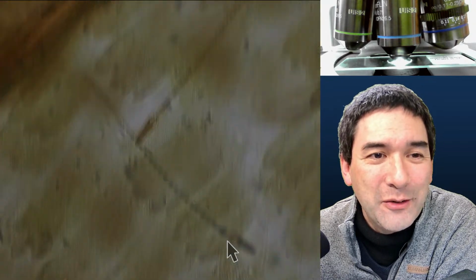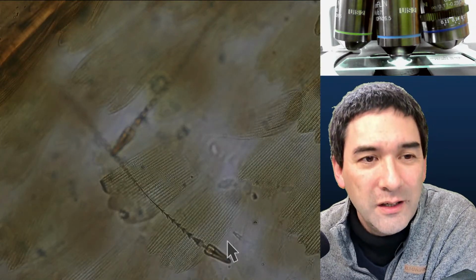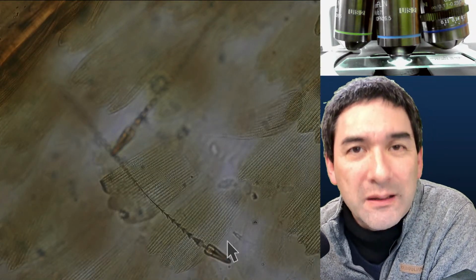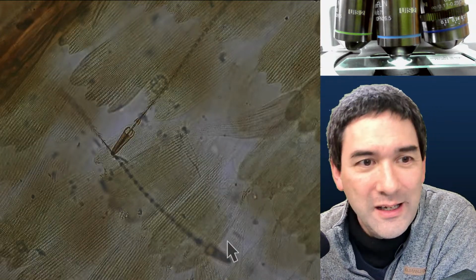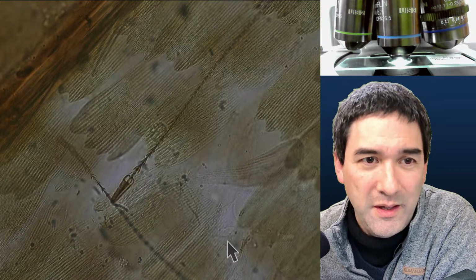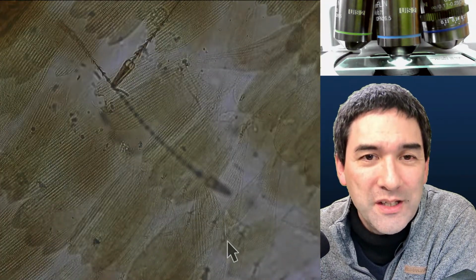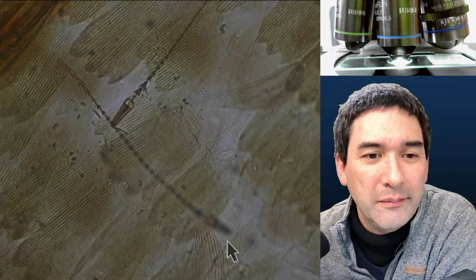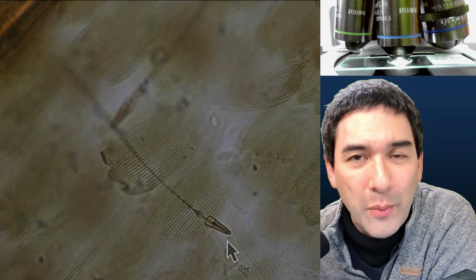Several years ago, I did post a question in a microscopy forum, and I even got an answer. As a matter of fact, these are the so-called setae, which are the hair of the larva of a carpet beetle. A carpet beetle is an insect, obviously, and it has a larva, and those larvae are very hairy. And this is one of their hairs. And the question is, what in the world does this have to do on a sample of a butterfly wing?